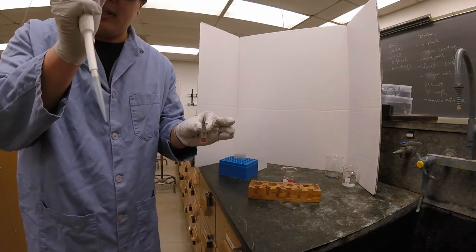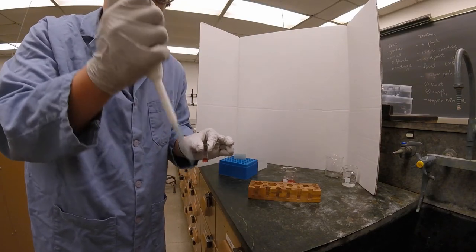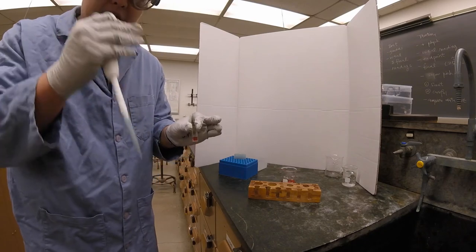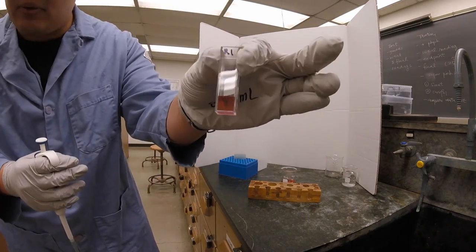Unlike the pipette where there's a little bit of liquid inside, these are actually designed so that you press it to the second stop to expel everything out. And now we have our liquid in our cuvette.